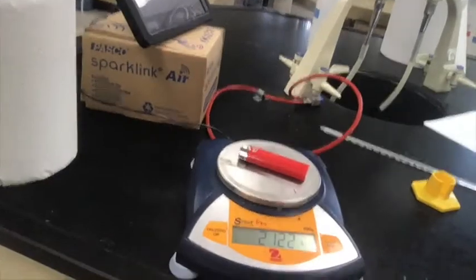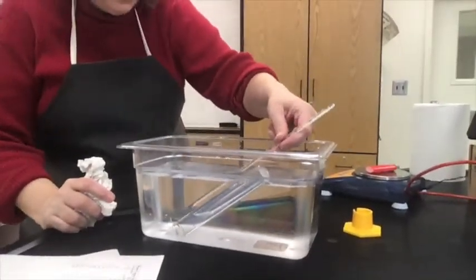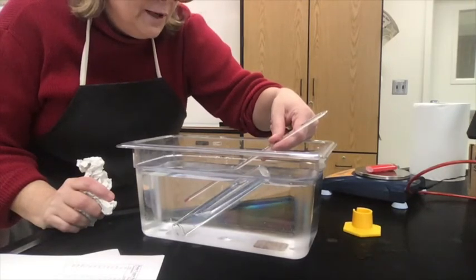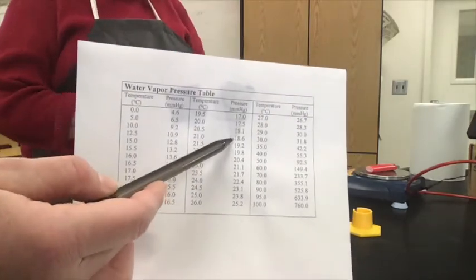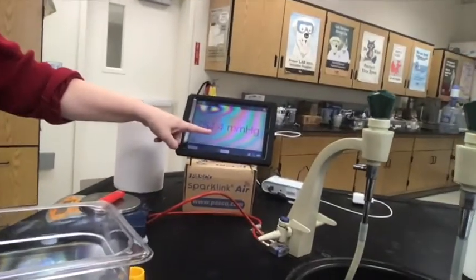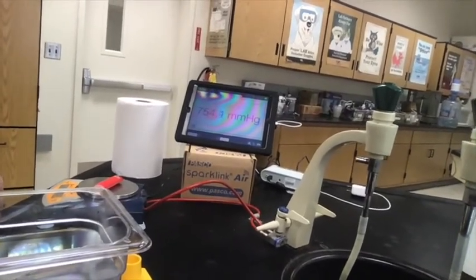All right, here's our final mass reading for that butane lighter for trial 3, right? We're on trial 3. Okay, yep. All right. And getting our temperature, probably hasn't changed. I'm going to say it's still 21.0, which means our partial pressure of the water vapor is still 18.6. That hasn't changed. Okay, and we can look over here at the atmospheric pressure. I think it's going up a little bit. So you should actually have a different atmospheric pressure for trial 3 when you get to this.